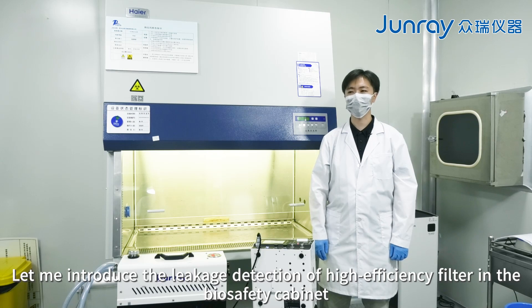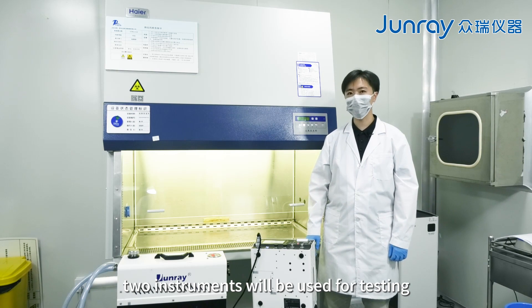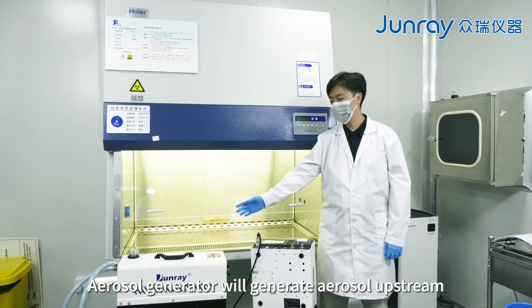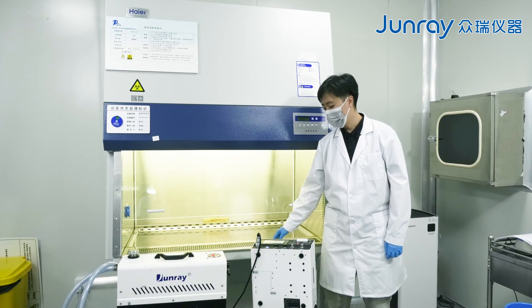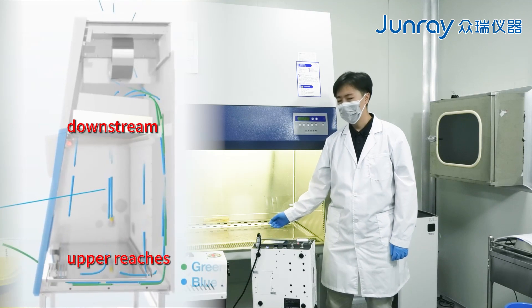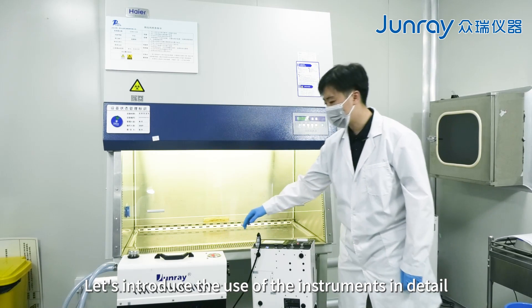Hello everyone. Let me introduce the leakage detection of the high efficiency filter in the biosafety cabinet. Two instruments will be used for testing: aerosol generator and aerosol photometer. The aerosol generator will generate aerosol upstream and feed it into the biosafety cabinet. The aerosol photometer will be used to detect the upstream and downstream concentrations, so as to check the leakage of the high efficiency filter. Let's introduce the use of these instruments in detail.